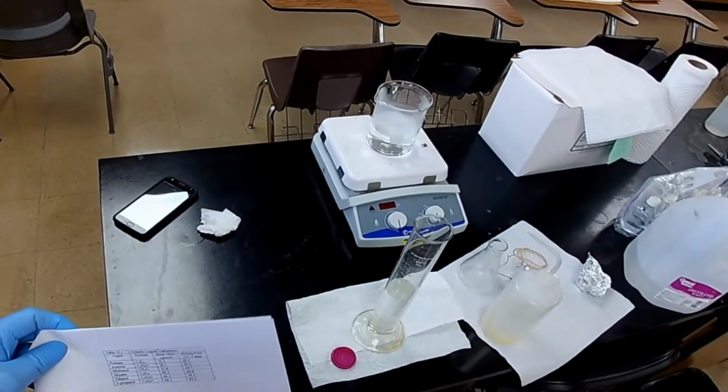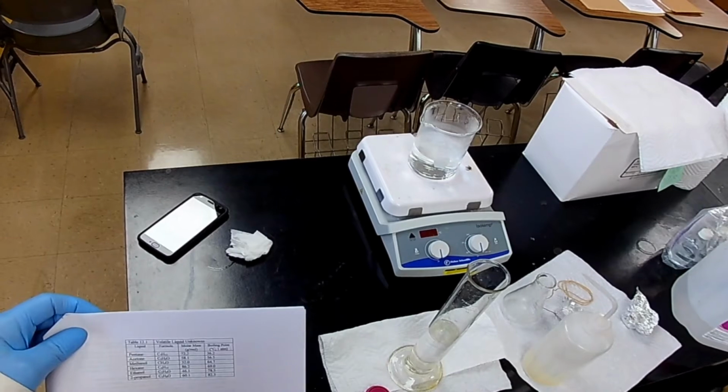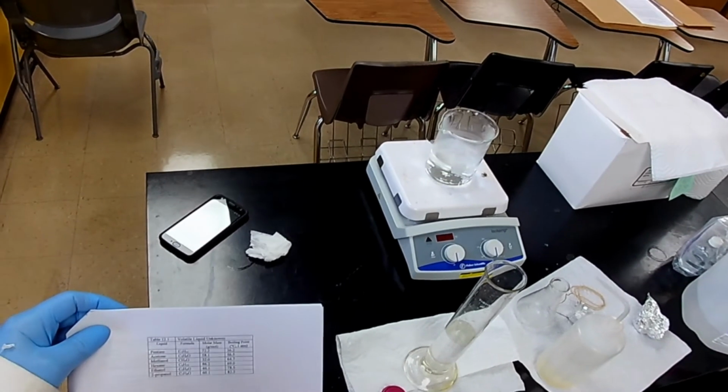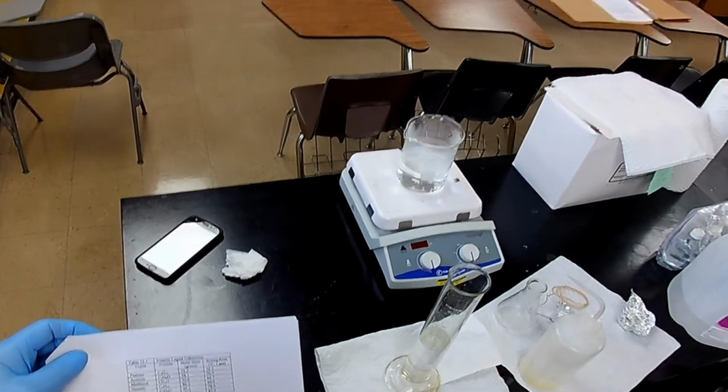65.5. Okay, we need our list. We need our list. Maybe I shouldn't do this. Let you figure it out. Actually, there's nothing in here that matches it. What's the closest one?